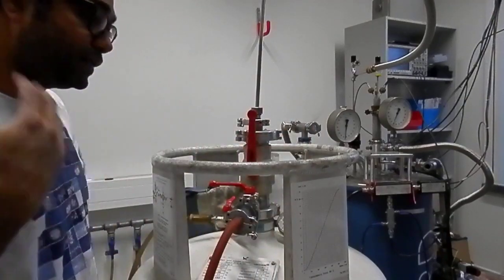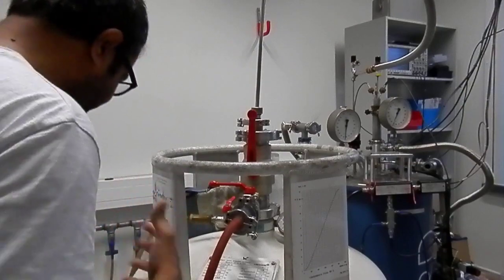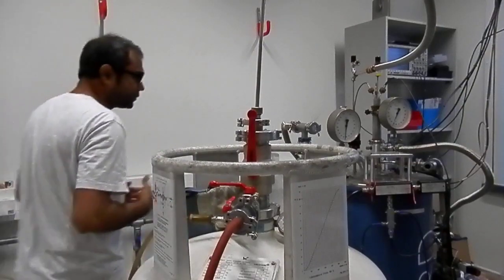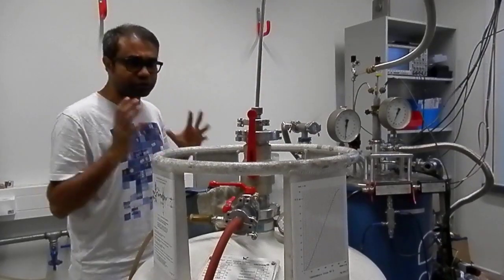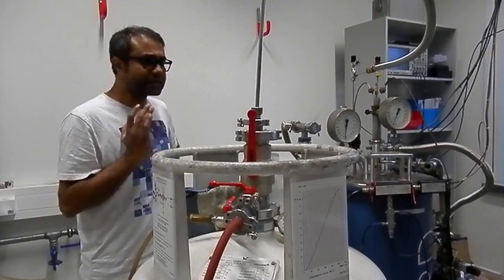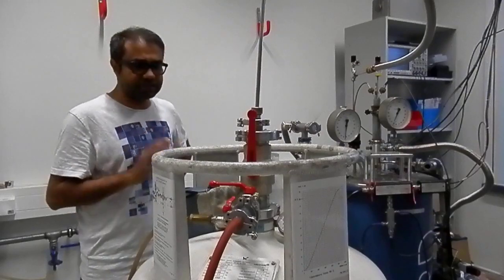And second thing, when you are filling helium, when you just start filling helium and are not really a professional yet, then it's better not to do the helium fill alone. It's better to have somebody else present in the room.